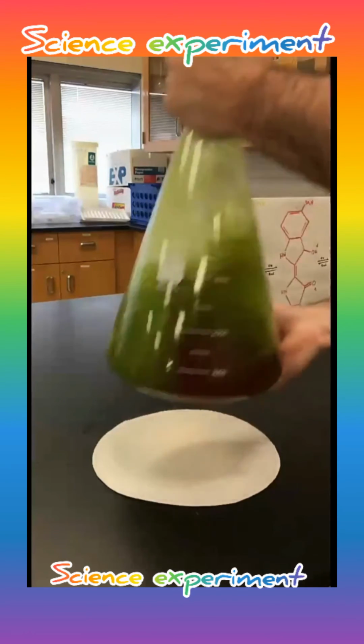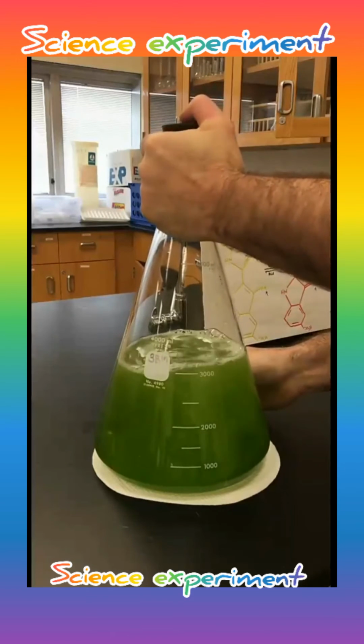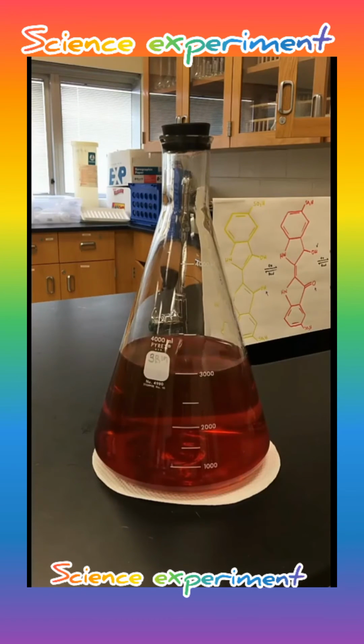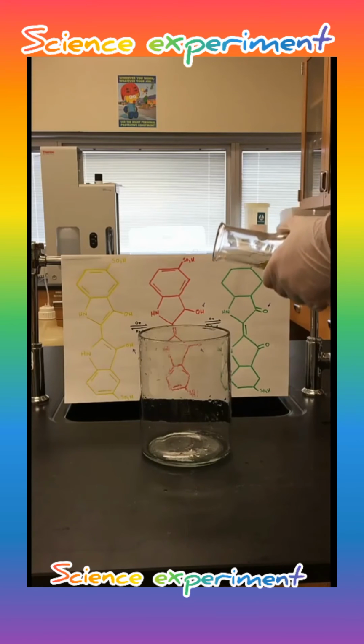If we give it a little more vigorous shake, we go through red and get to green. And as it sits, the sugar reduces it from green down to red. And then if we let it sit, it will come back to yellow.